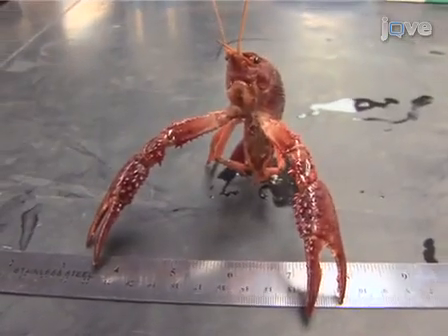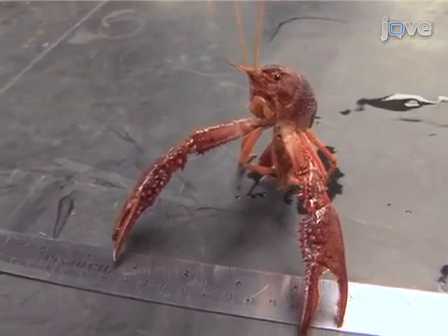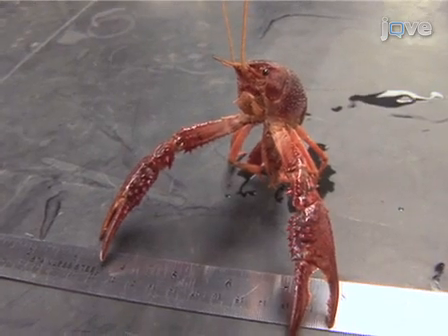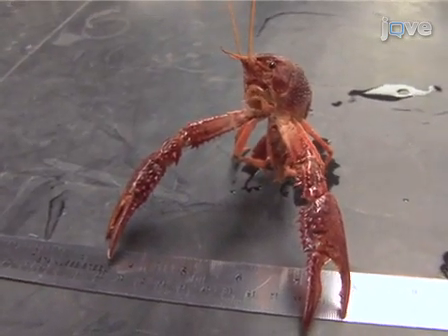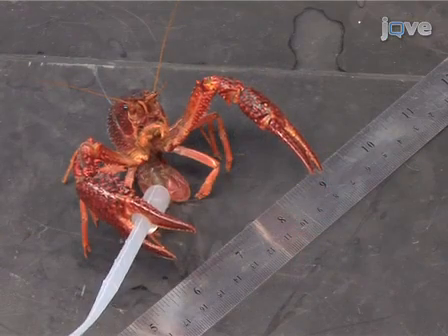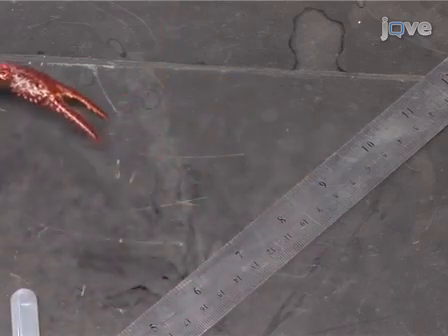In the next part of the experiment, the electrochemical properties of axons will be examined in the ventral nerve cord of the crayfish. The properties of passive current spread presented in the model circuits are also observed in live preparations. However, an action potential is needed whenever a signal needs to be transmitted over a distance of a few millimeters, because the passive electrical properties of cells would attenuate the signals over this distance.